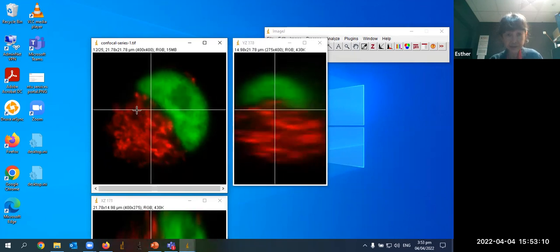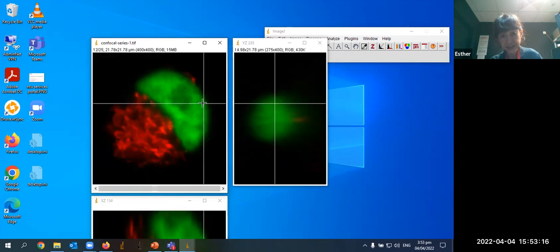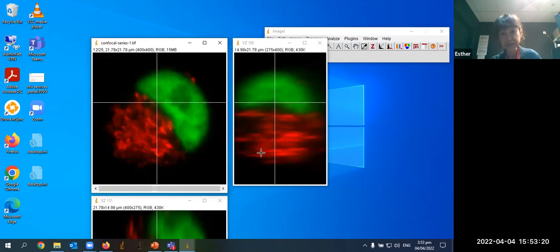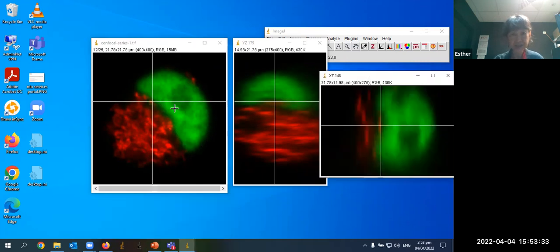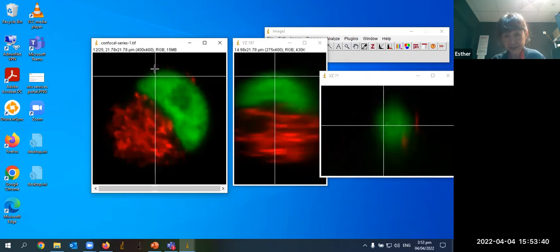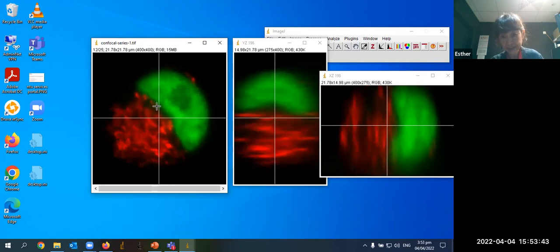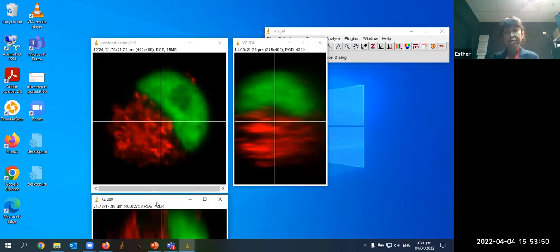Okay. So if I move the vertical crosshair, it's like I'm slicing through the object vertically, and this image on the right shows you what you're looking at where the slice position is. Okay, and there is also an XZ view here. My screen is not big enough to show everything. So if you move this other crosshair, you can see the horizontal slice views. Okay. Yeah, this is one of the most common ways to show 3D data actually, if you don't have a more complicated imaging software to visualize your 3D data.